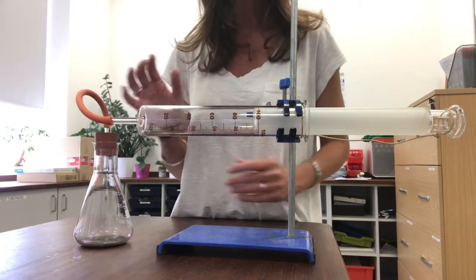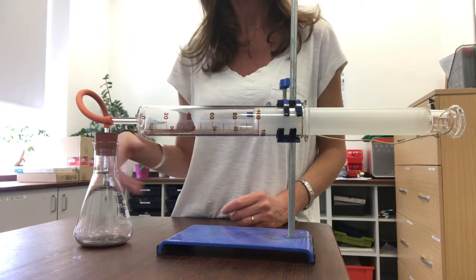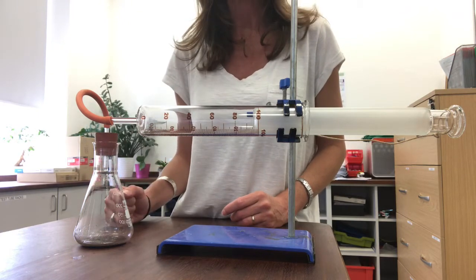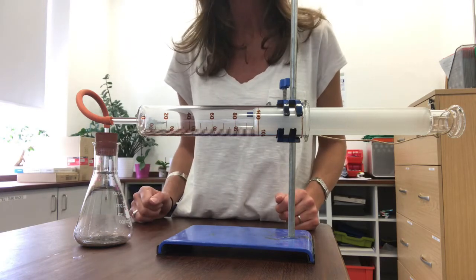I'm going to leave it for a week and I'll come back and hopefully the plunger will have moved in on my gas syringe to indicate something about the volume of oxygen that was used up by the iron reacting with it. So I'll see you shortly and we'll have a look at what's happened to our experiment.